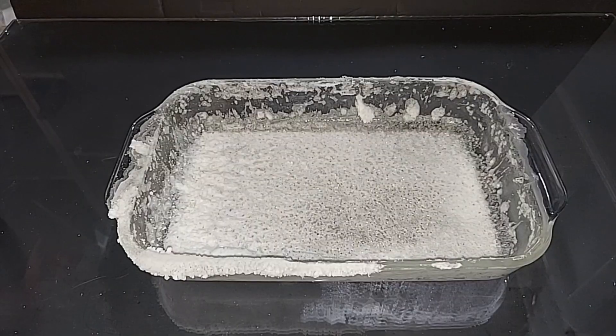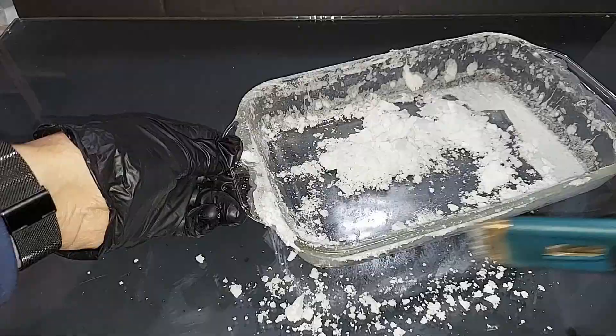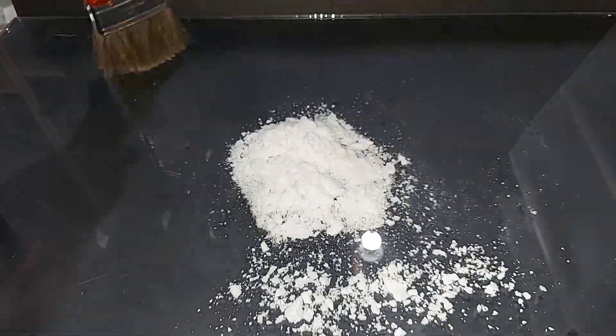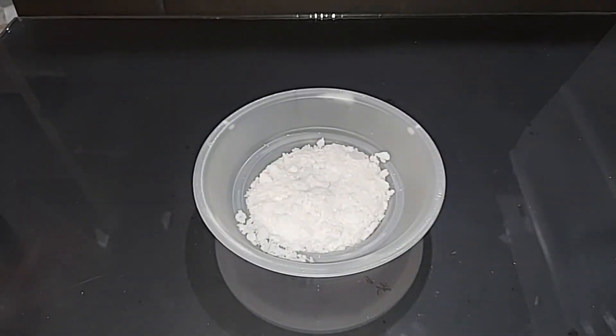Okay let's break it up, these crystals are looking pretty tough. I cleaned this off the best I could, it's never perfect but that's gonna have to be good enough.